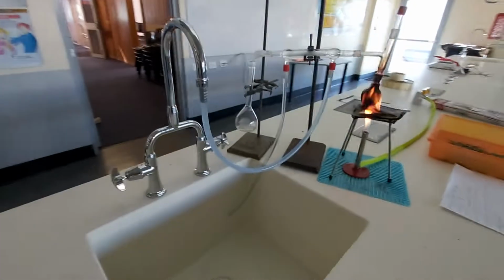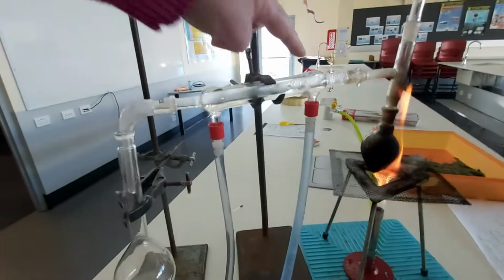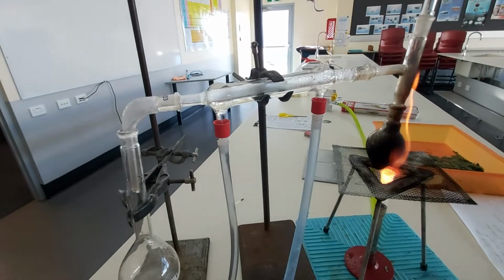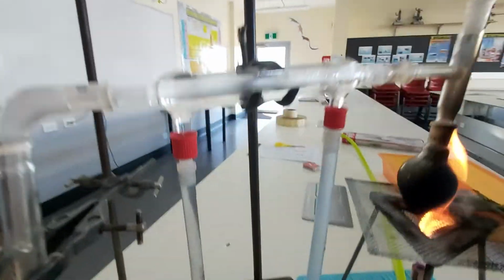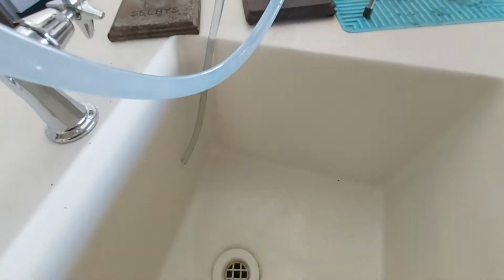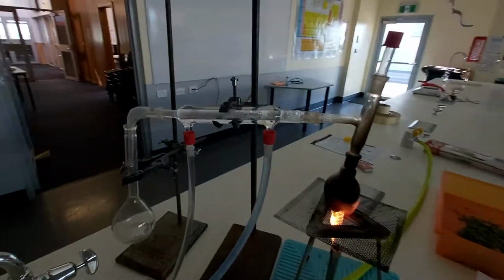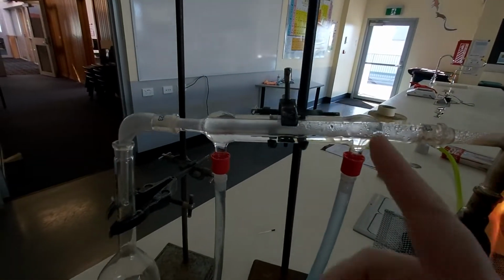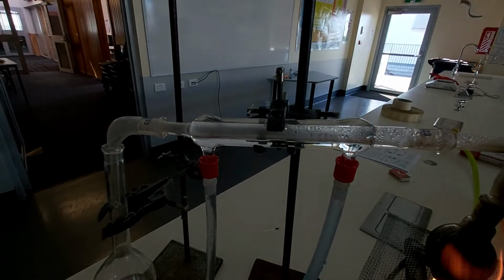So what I've got going here with the tap, if I turn that off, there's water running through here. When I turn that back on, you might see that coming through again. All right, and then the water going around the outside comes down this tube and back into the sink. So when I've got this cold water running through here, it makes this part of the tube really cold, okay, which makes water condense.